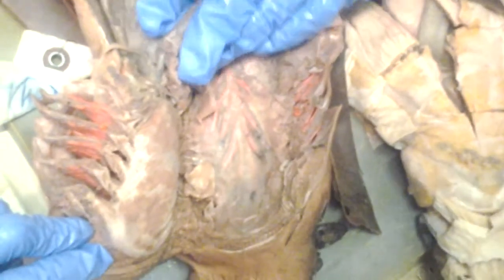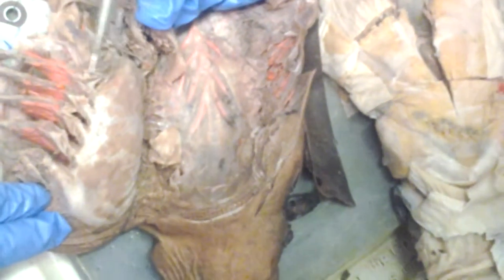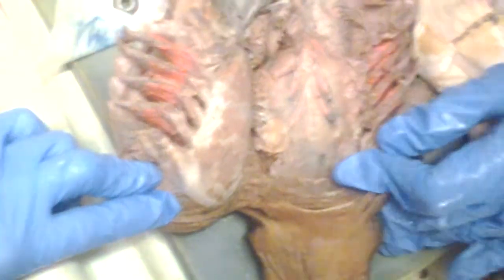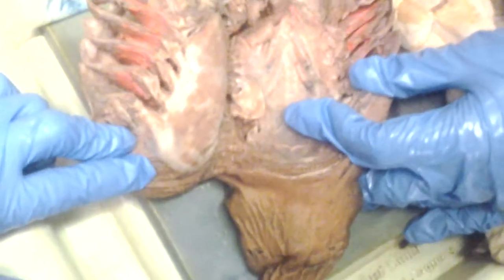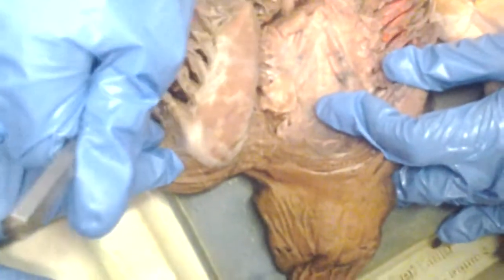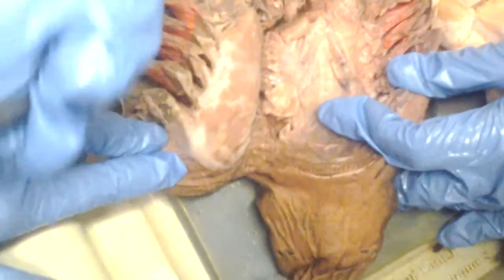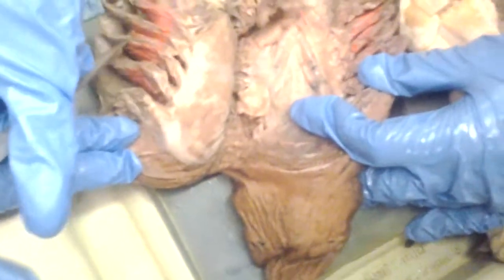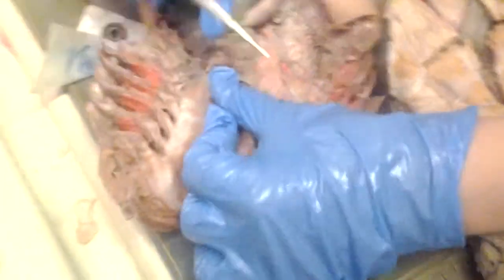Can I ask one question? So the lamella, it's not the red stuff, it's the underneath brown stuff inside, right? So these are each gill lamellae. If the pin is in the brown, that's the lamella. Well, even if it's in the red, really. You wouldn't ask us for the blood vessels between; you'll ask us for lamellae. If it's here, it's going to be lamellae.